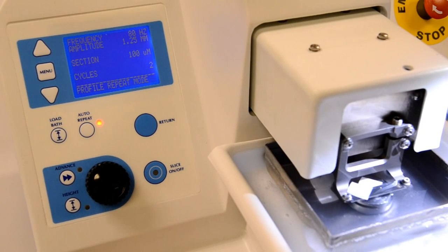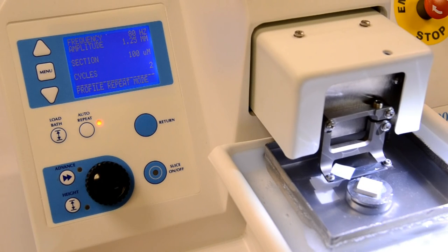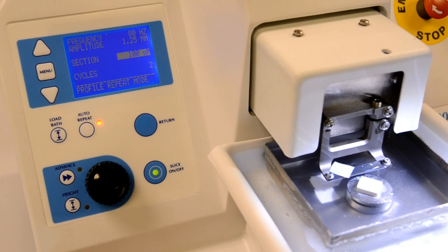If you want to stop the procedure, you can press the slice on-off key at any time or in an emergency, the emergency stop button. Refer to the operator's manual for step-by-step instructions.